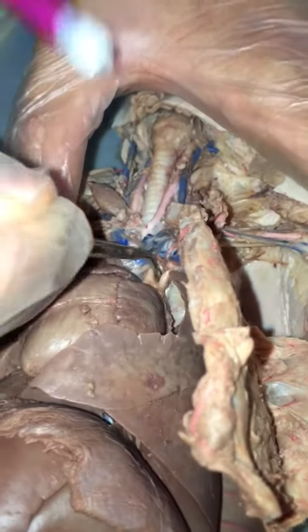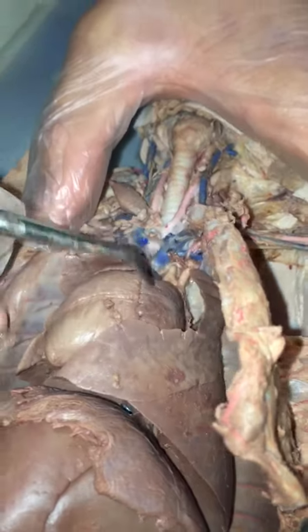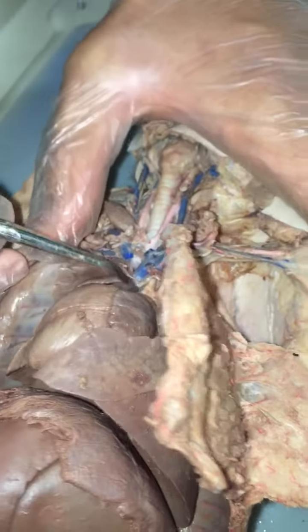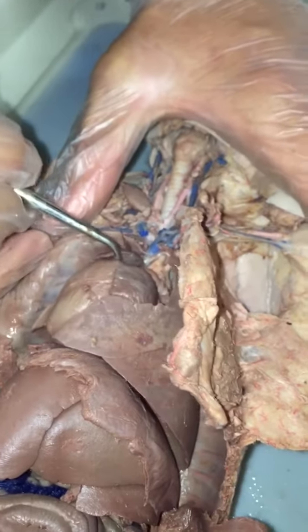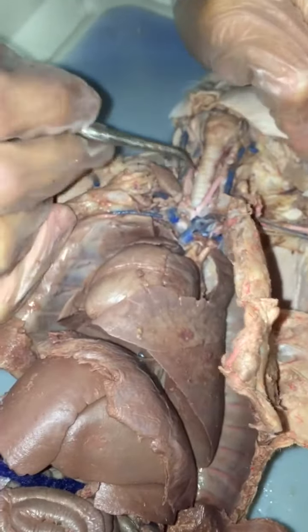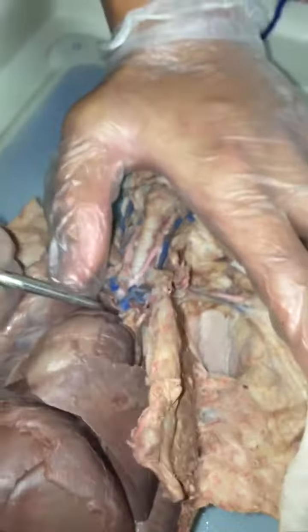So that's the carotid trunk down there, where the common carotid arteries meet. Left subclavian, we said that. And the subclavian vein, the jugular vein is right by it, right? Yeah, jugulars are the blue ones right by it, but we'll do that later.